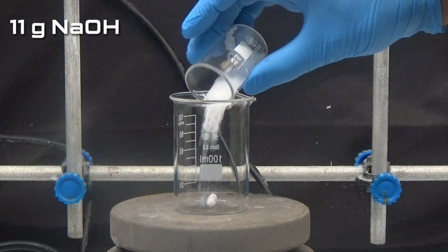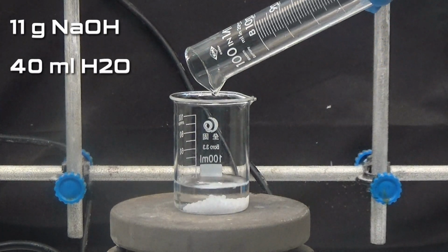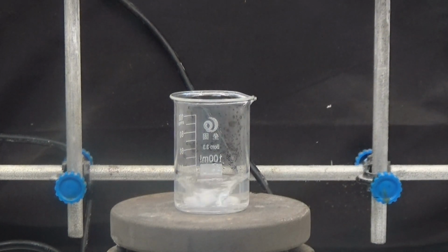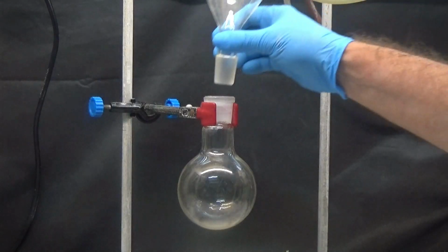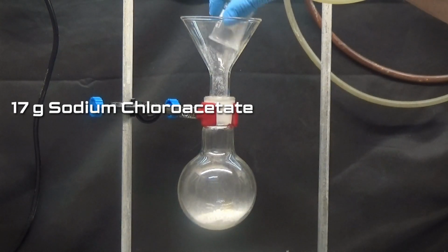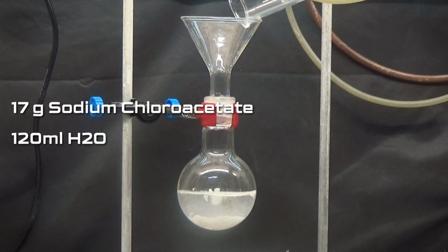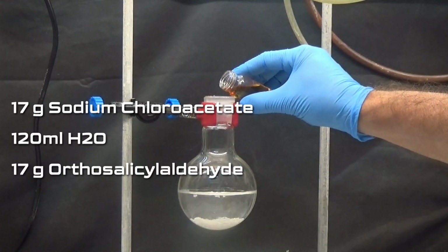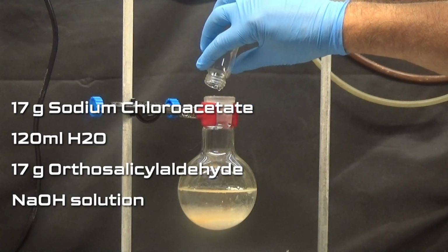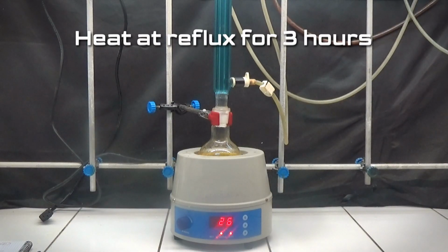For this synthesis, we will need to prepare a solution of 11 grams of sodium hydroxide in 40 milliliters of water. In a 250 milliliter flask, put 17 grams of sodium chloroacetate and 120 milliliters of water. Add 17 grams of ortho-salicylaldehyde and with agitation add the sodium hydroxide solution. Heat at reflux for 3 hours.